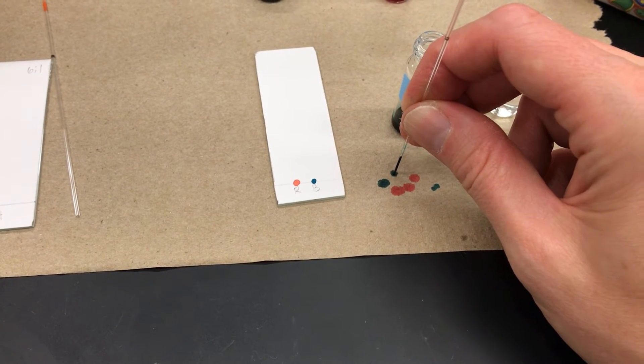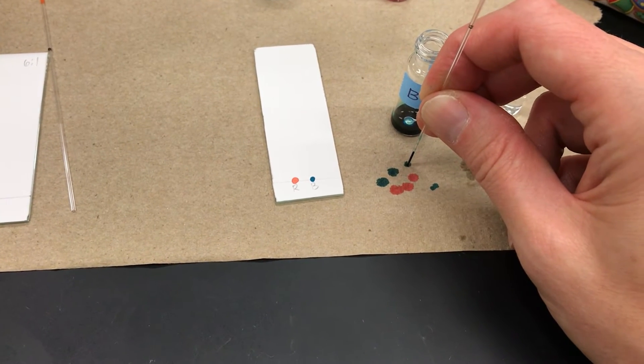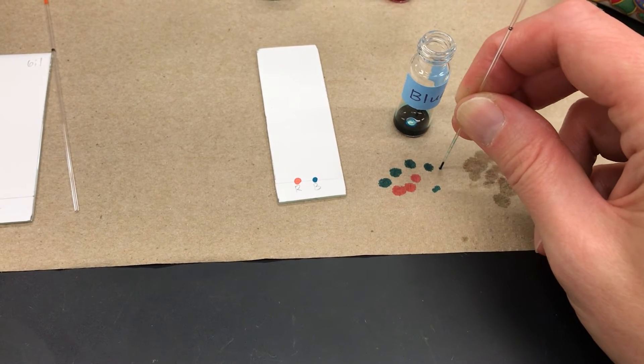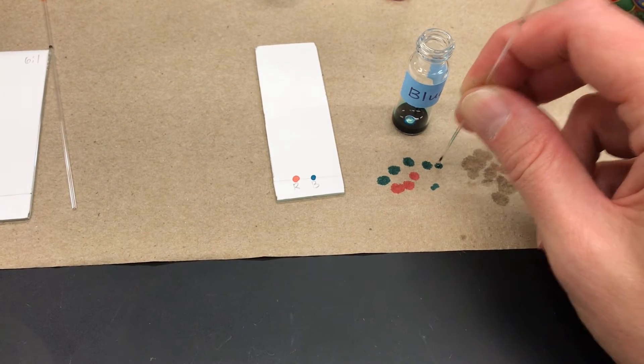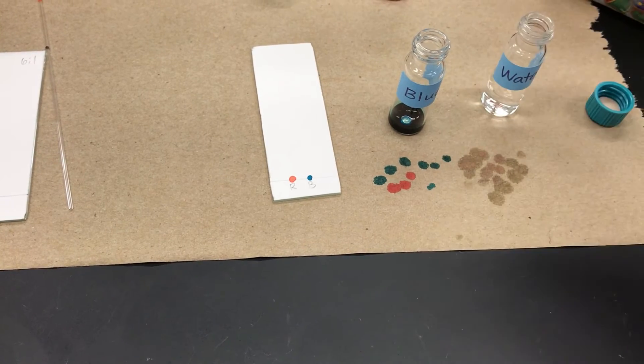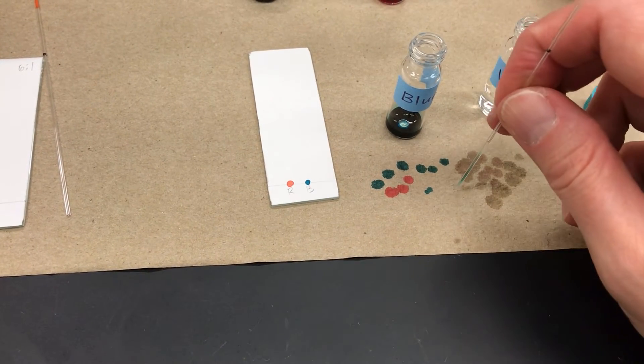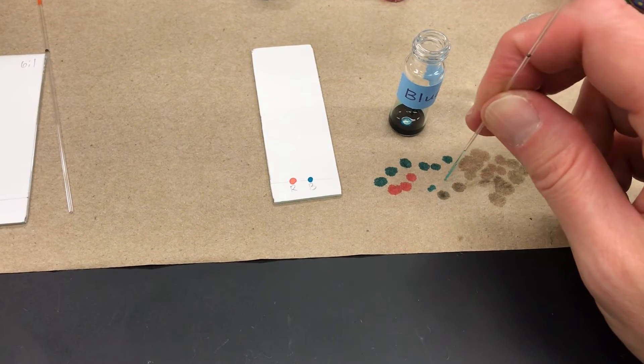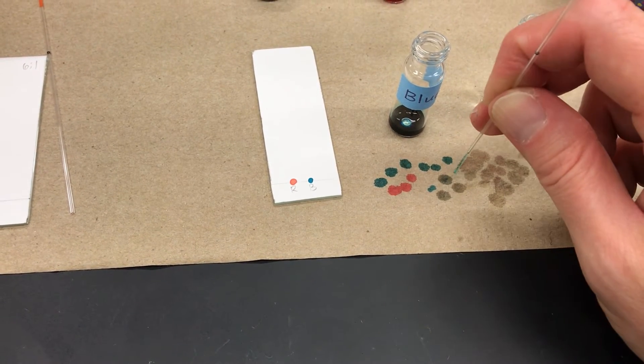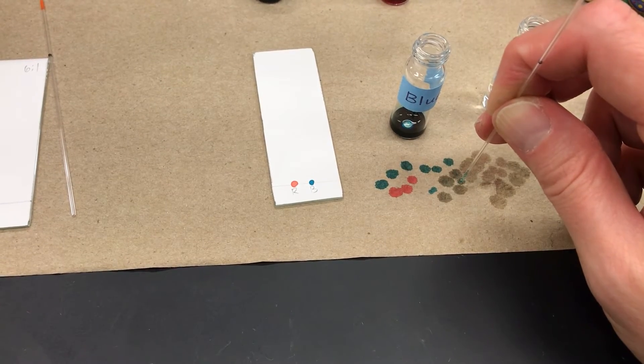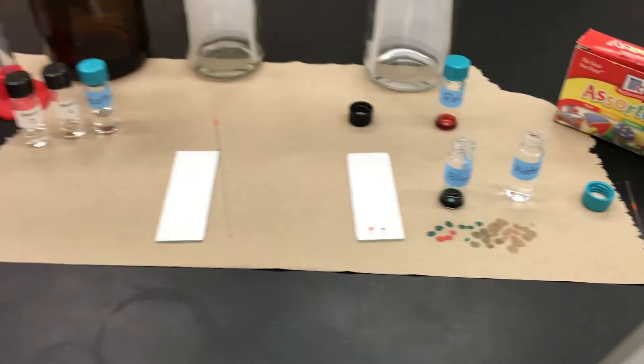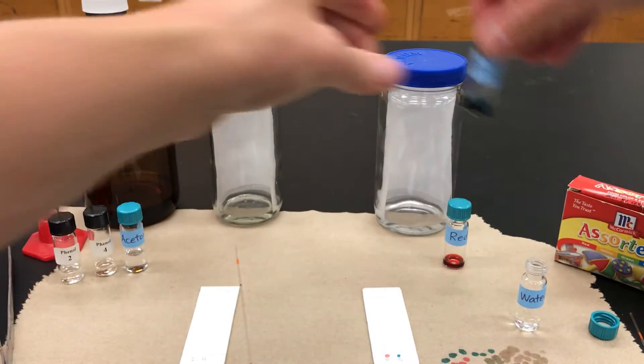And again, notice I'm draining it out quickly. Not just setting it down because that's when air can get in there. Drain it out completely and then rinse it with the water. And do close the lid so that you don't spill.